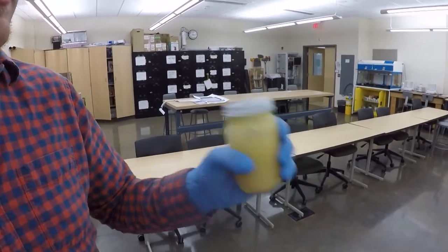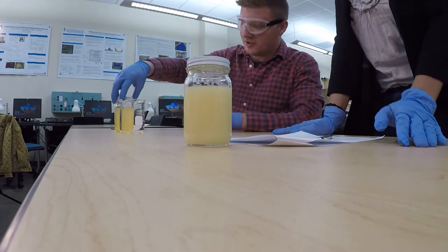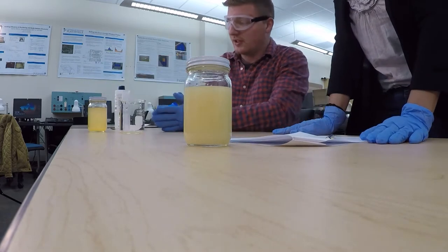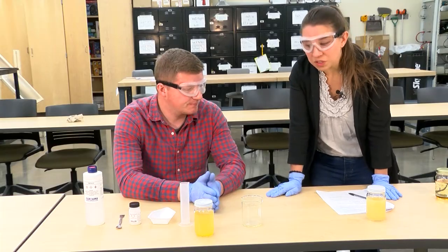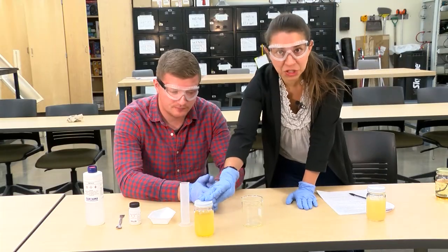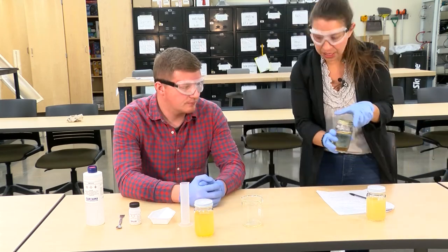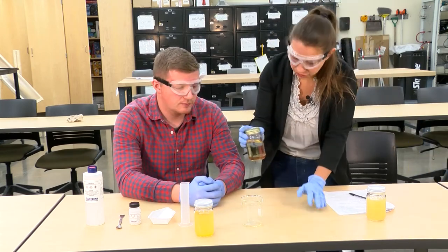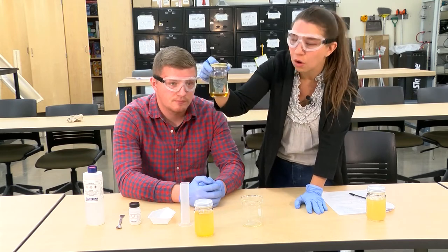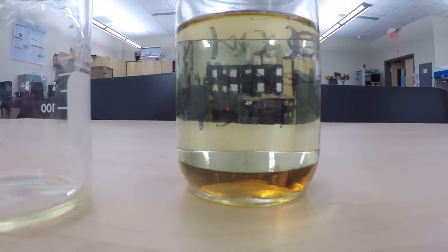I'm going to shake that for about 10 minutes and it's going to result in this mixture here. Once we let this mixture wait for a while — some people choose to let it wait for a couple of hours or overnight — in our case, we have something that looks a little bit like this.